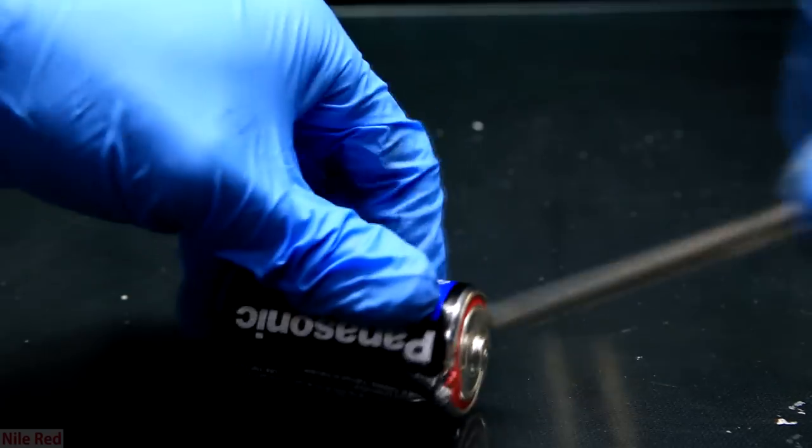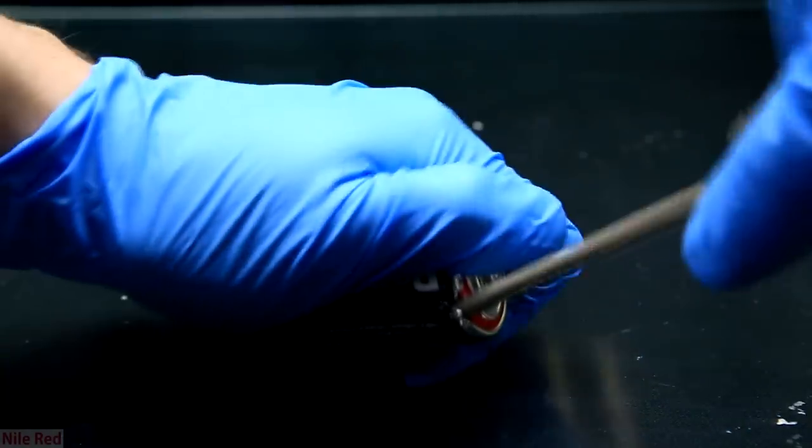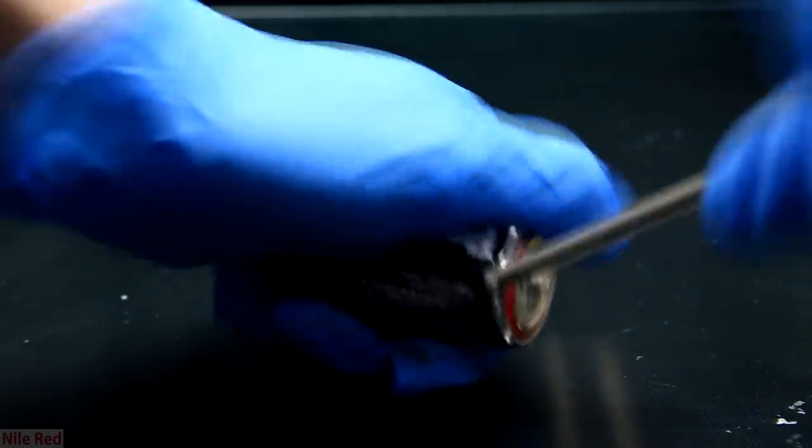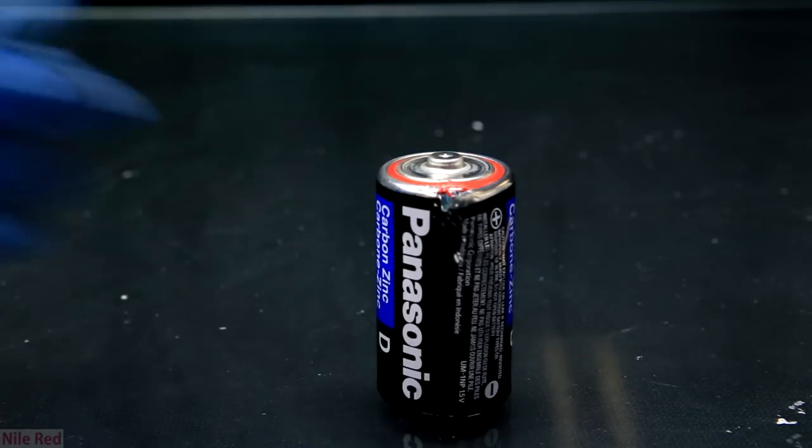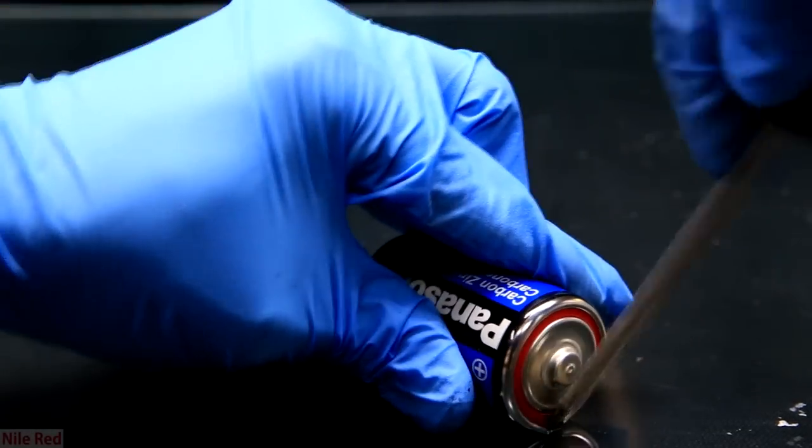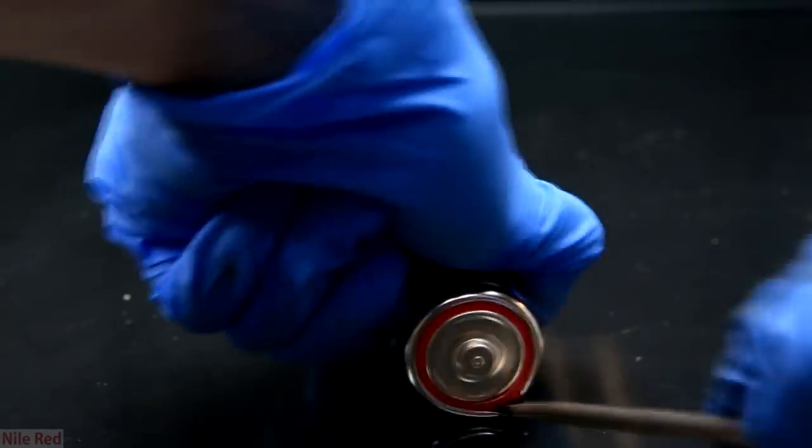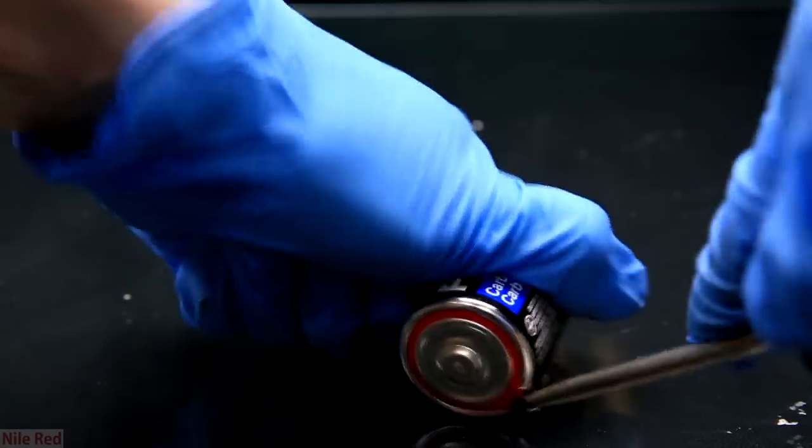The first time you try it it might look like this and it's hard to separate, you apply some force and it still doesn't come apart. If this happens it means you're not using a good technique. Here is a shot of where a better technique is used and you'll see the big difference. The ends of the outer casing were crimped together in such a way that one was kind of slid in under the other.